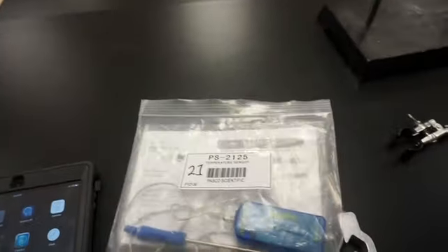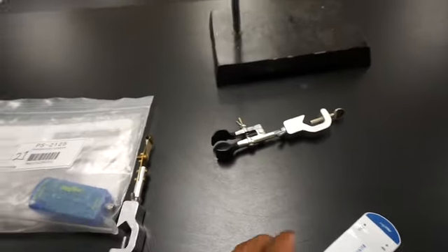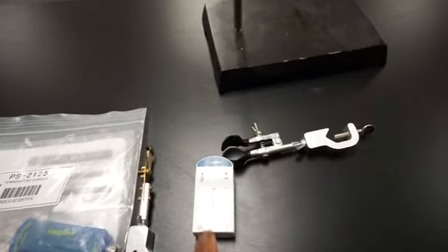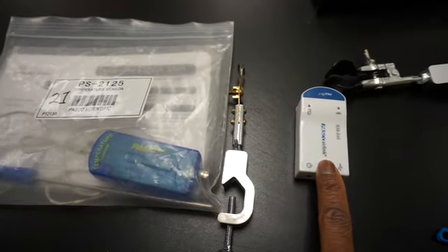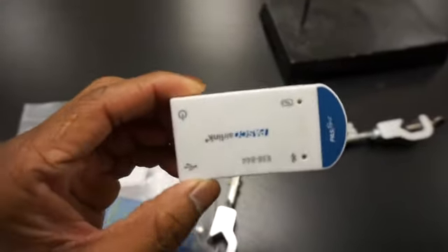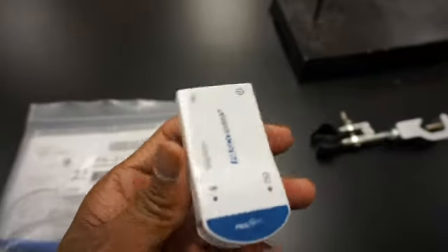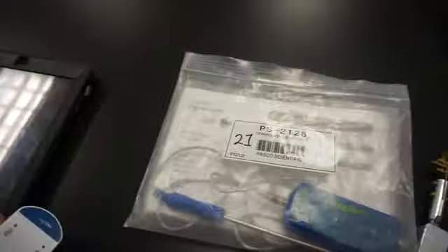This is an attempt to record this by myself. You will be using a temperature probe and you might be using an Apple device. If you do so, that could be your own or our iPads. Then you'll require this dongle in order to connect the PASCO sensors to the iDevices.